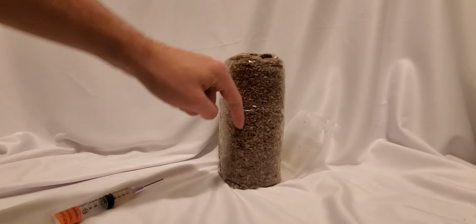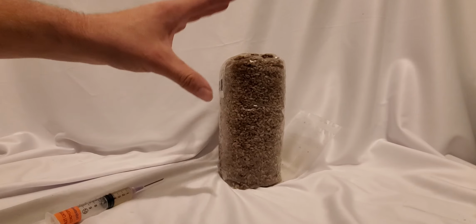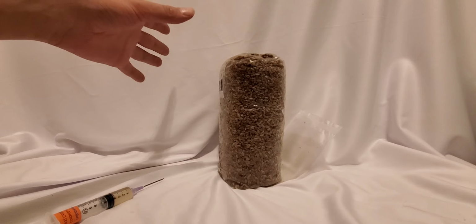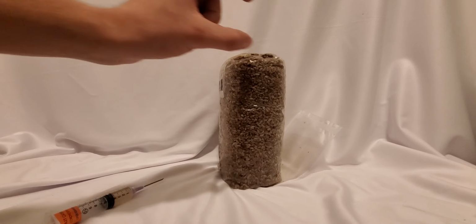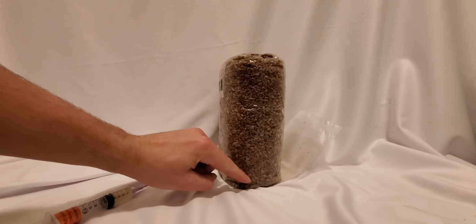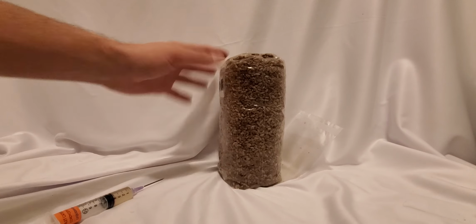It almost makes shaking unnecessary, but shaking is still good to do, and to do early on, and it also makes shaking easier because you don't have to shake the grain from the bottom and mix it all the way through. You just have to mix it a little bit throughout the entire thing.